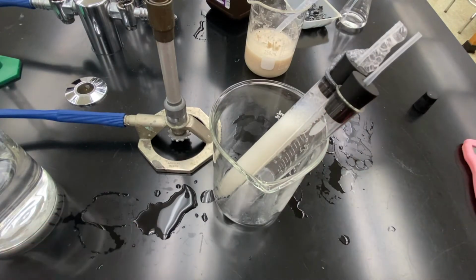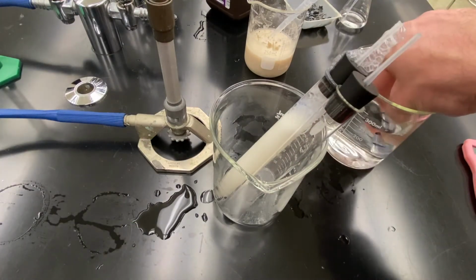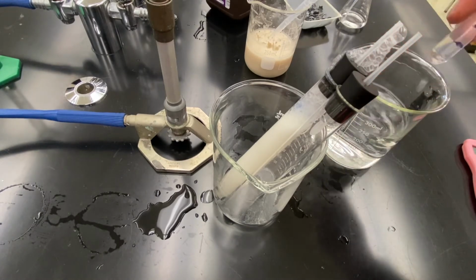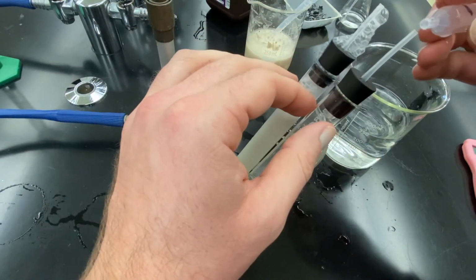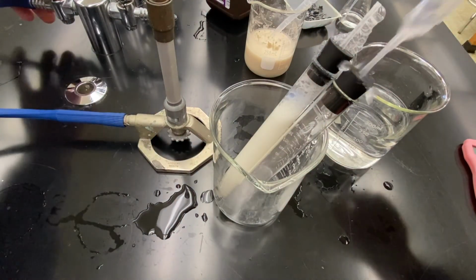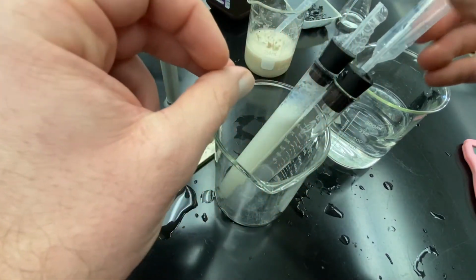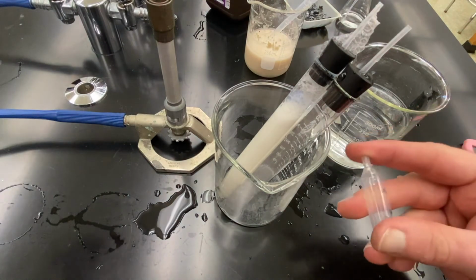And so now I could take my calibrated bulb, fill it with water, and I'm going to test the combustion of these gases. First, I'm going to try just pure hydrogen. So 3 parts hydrogen, 0 parts oxygen. I'm going to, uh-oh, that popped right off. Make sure I get all hydrogen in there. I'm going to hold on to that. I'm going to hold my finger over it.